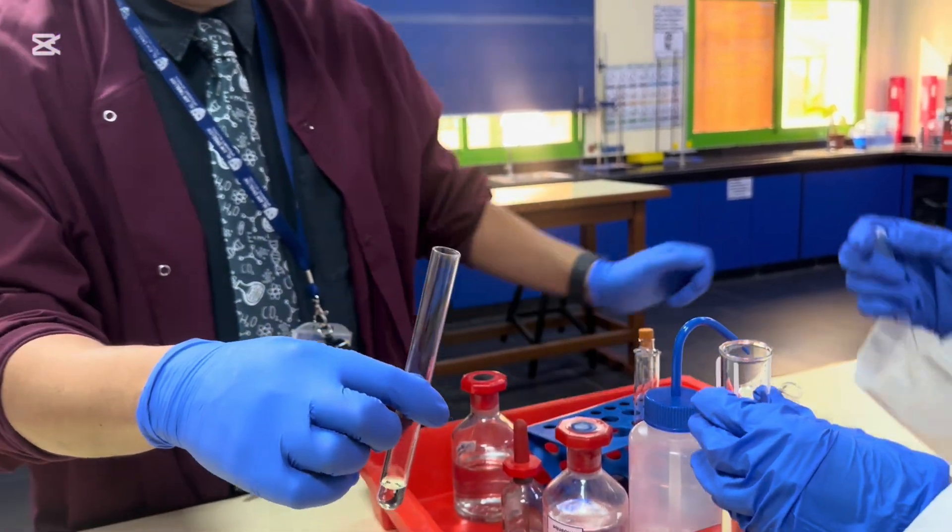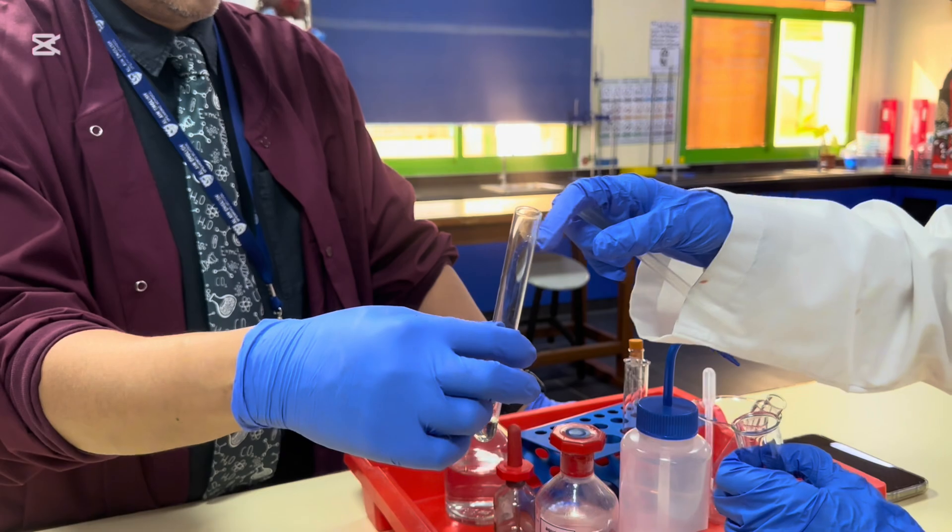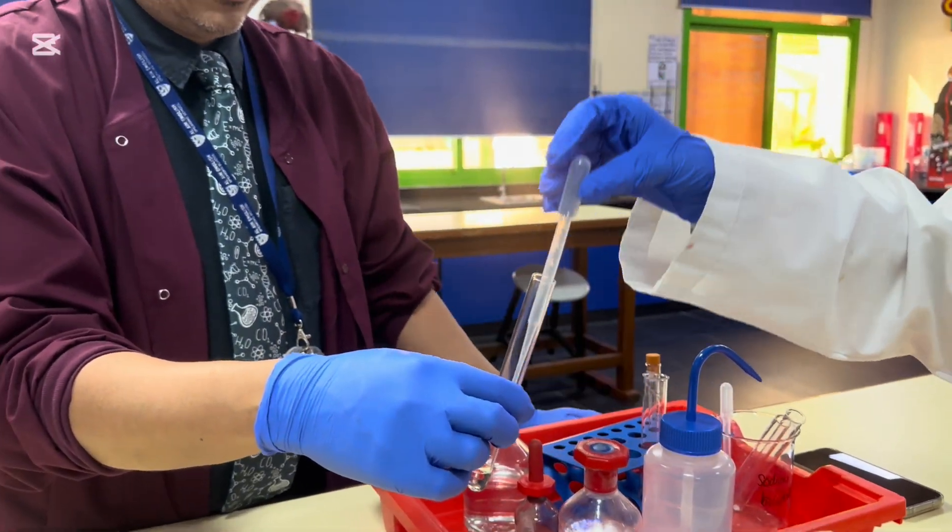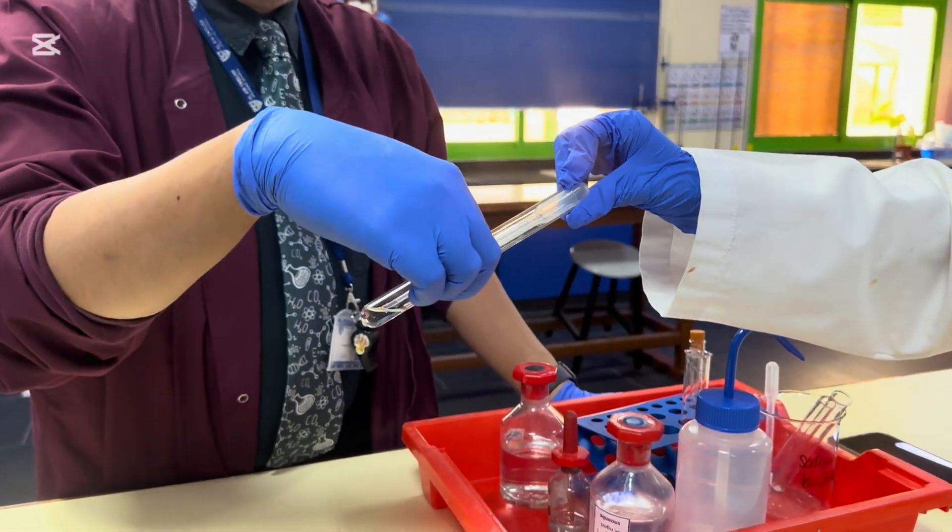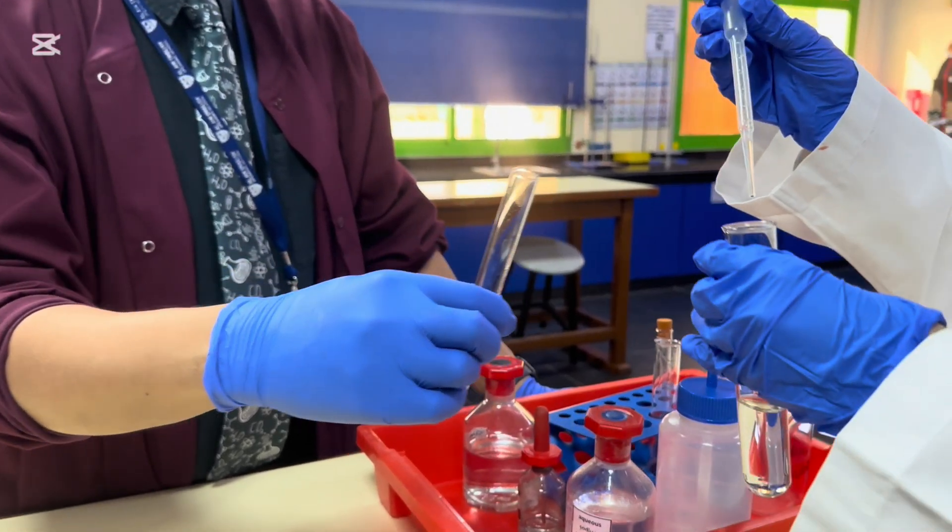So do I just pour it? You can just extract it. Like that? Yeah. Just squeeze some of it. Squeeze some using that. Sorry, this isn't long enough. There we go. We'll make sure it is. Okay. Sorry, I think it's developed. Okay, we've got some. We've got some.